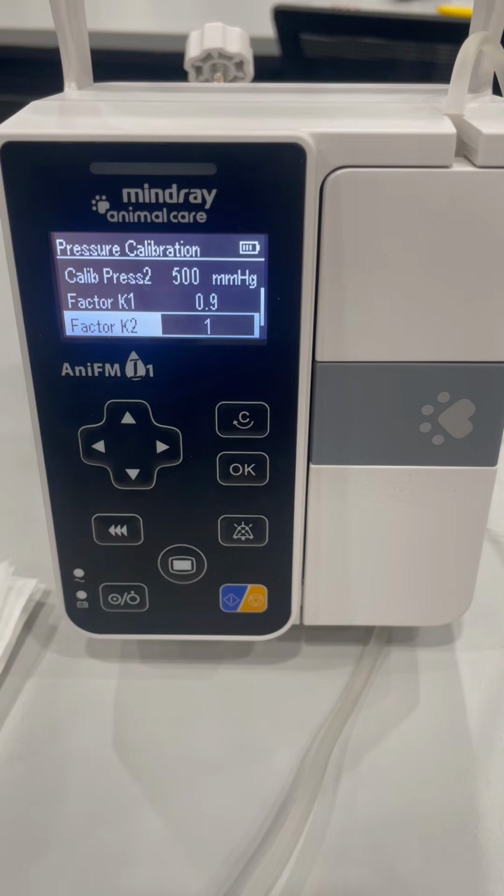So this way will help us find an easy way to do a batch calibration. We just use one unit to finish the calibration, and then we copy the data to the others.